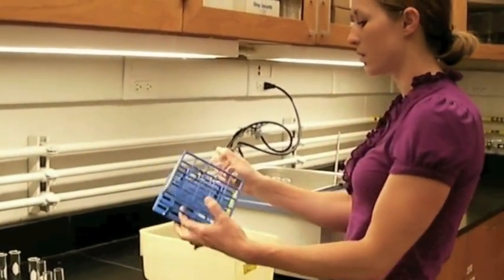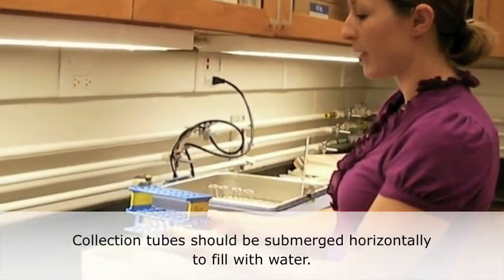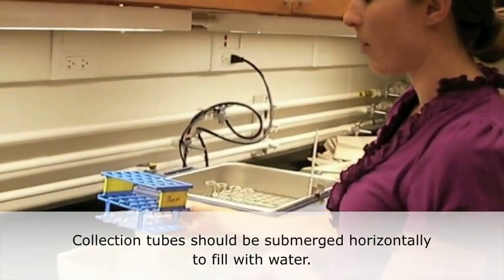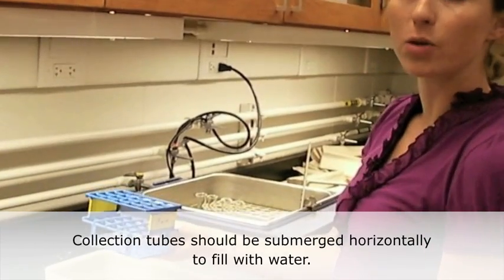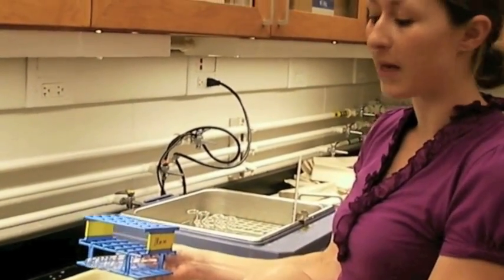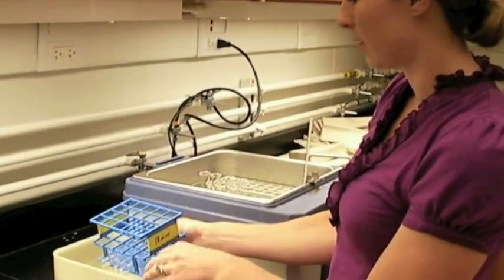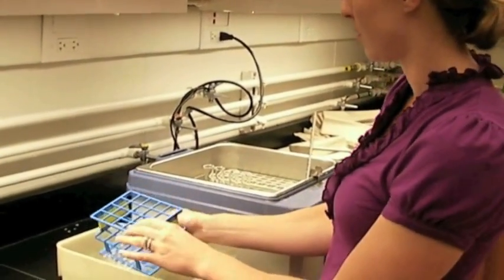The easiest way to do this is to stick the test tubes in a test tube rack, and we're going to place it horizontally down in the water so that the test tubes fill up. After that, I'll flip it over so the test tubes are upside down, and then move on to threading the tubing into the tubes.